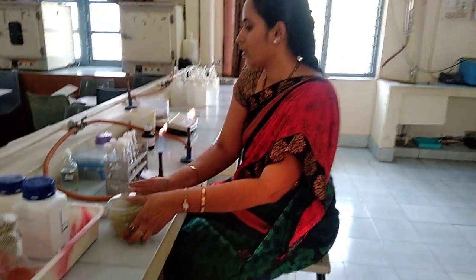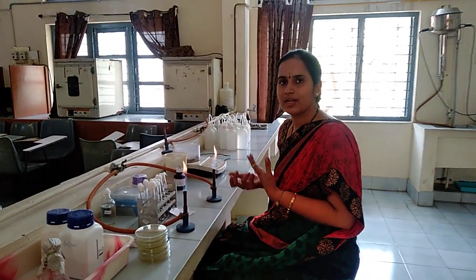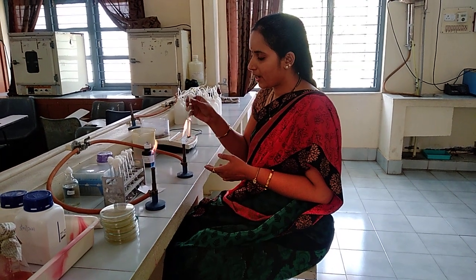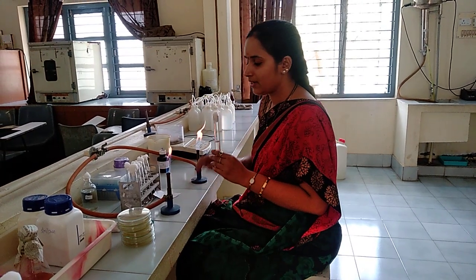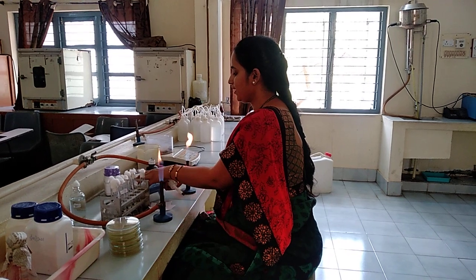The next important step is the source from where we need to isolate the fungal cultures. You can use a soil sample, food sample, or water sample. I am using a soil sample to isolate fungal cultures. About 1 gram of soil sample has been dispensed in 10 ml of water and we need to go with serial dilution.